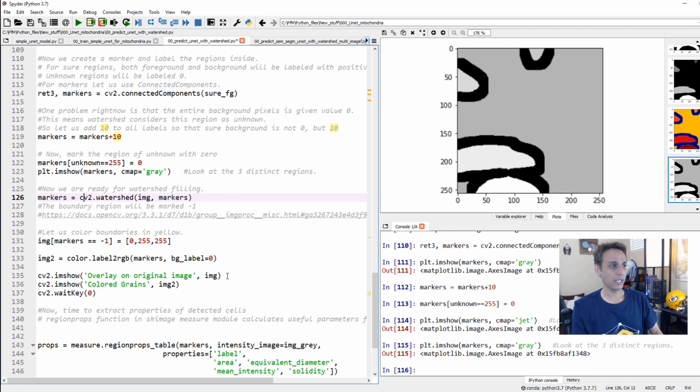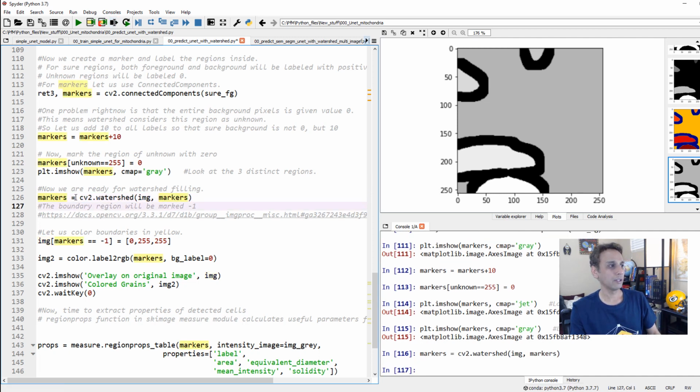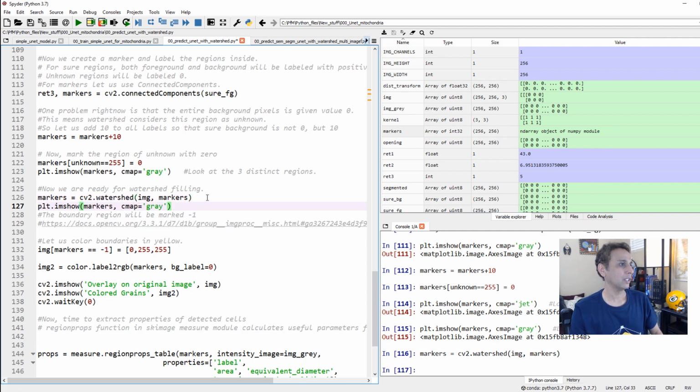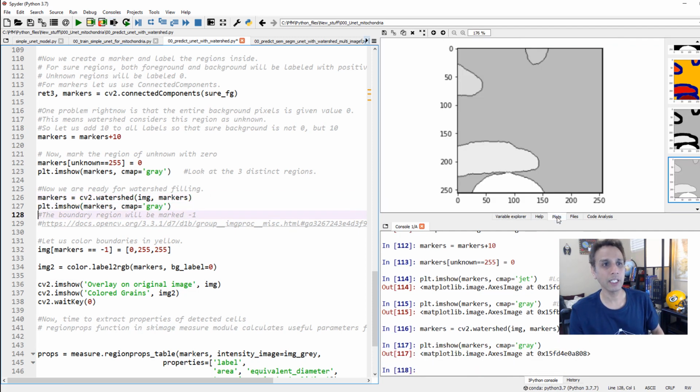And now let's go ahead and do our Watershed. For that I'm going to supply my original image and the markers where it is actually trying to work. So this is our new markers, and I think it does make sense to plot this just one more time. Okay, let's plot it, and there you go. It's already defined the boundary. You see, each object is separated. Now it's just a matter of processing.